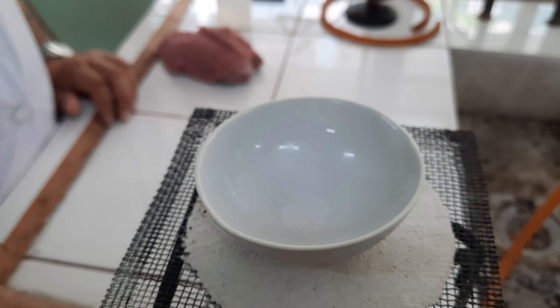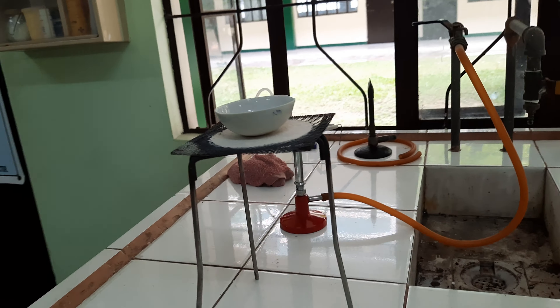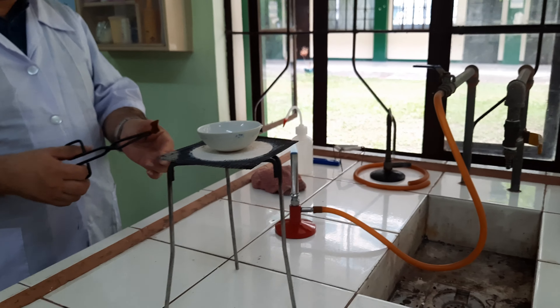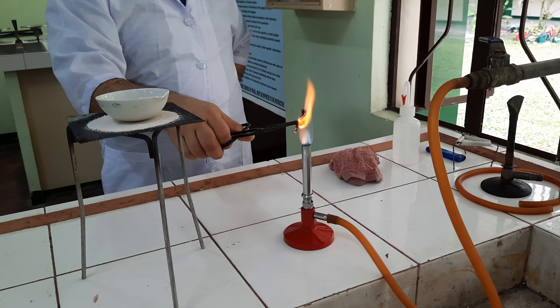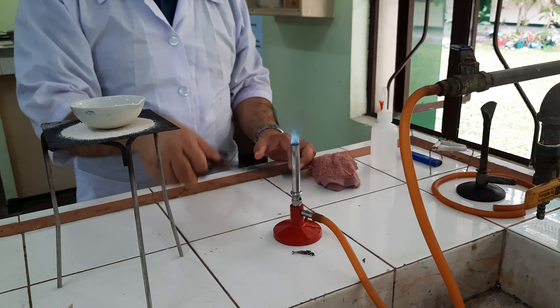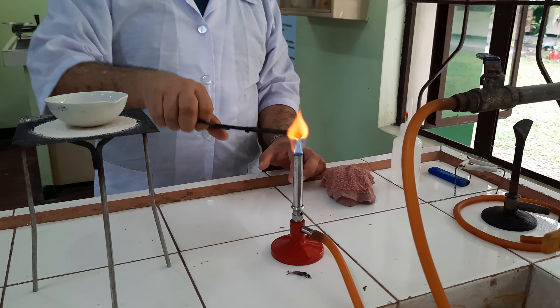It's almost gone. Let's go back to the alcohol — let's see if there is still alcohol remaining. There is a little left. Now let's proceed to our next procedure: igniting a piece of dried leaf. We'll try to ignite this — note what will happen. Let's burn it completely.